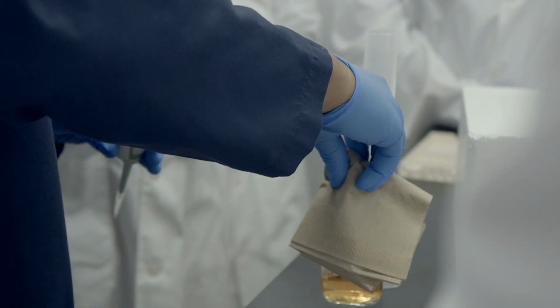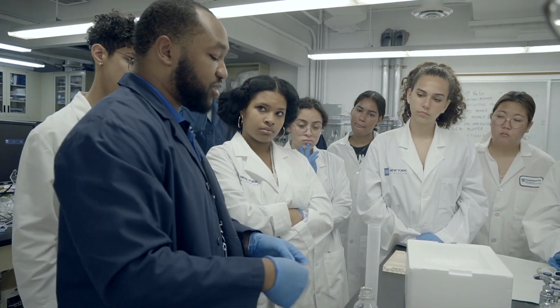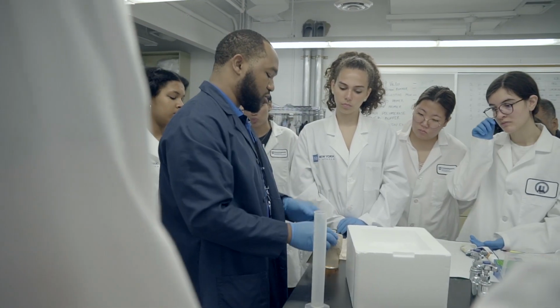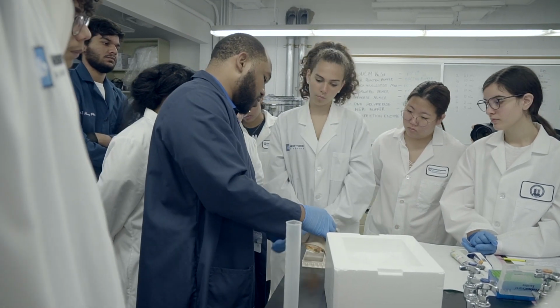Now, keep in mind, depending on the concentration of the gel, this may or may not be a more time-sensitive experiment, because it is a gel and it's at room temperature now, which means it's slowly hardening, right? So I don't want to be too slow in doing this, but I also don't want to rush and risk injuring myself. But while it's still hot, I'm just going to pour.